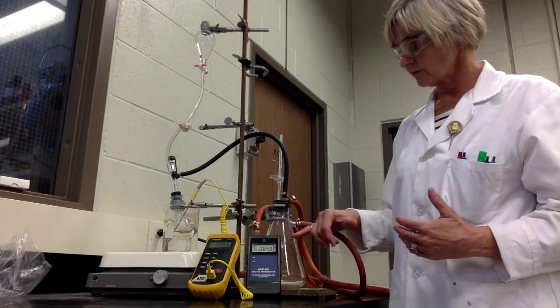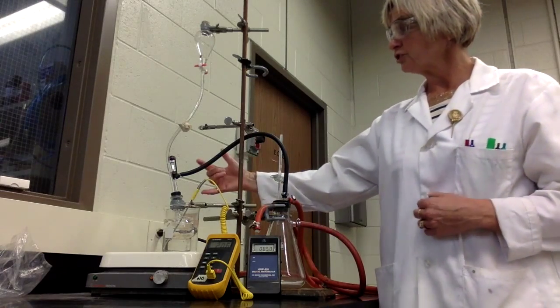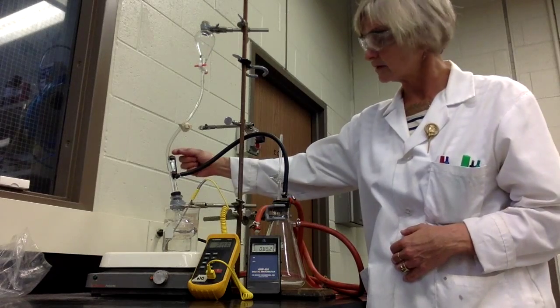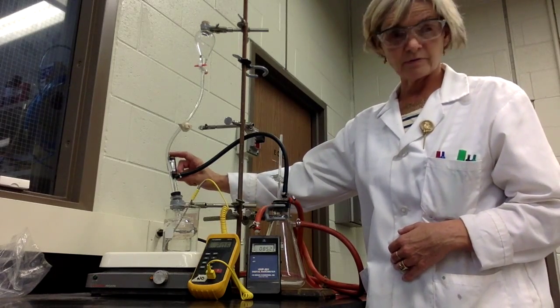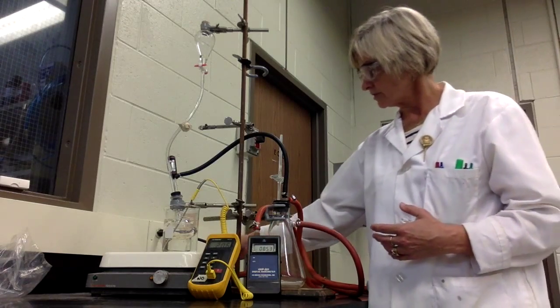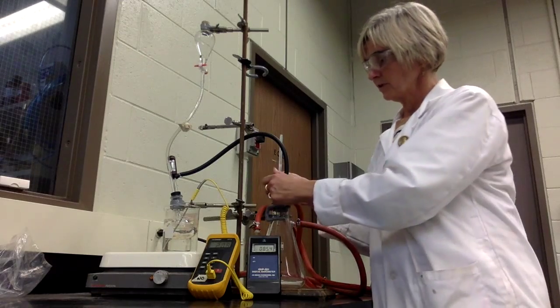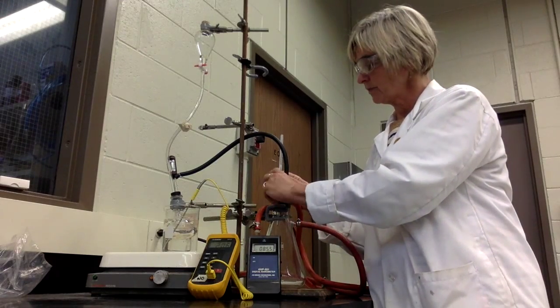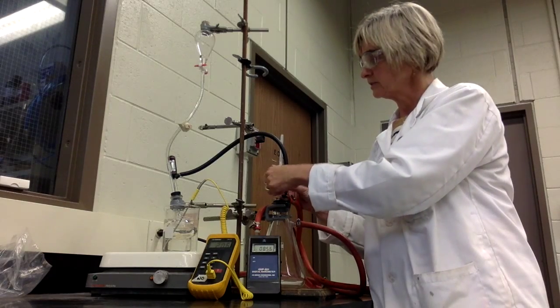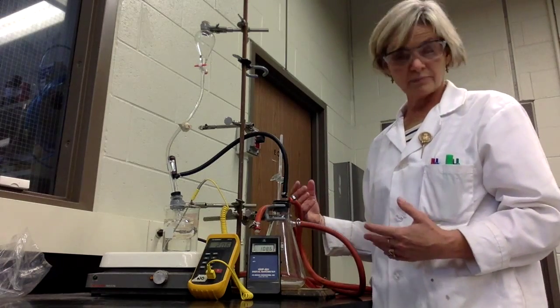What you'll see over time, as we increase the pressure, is an increase in your system temperature. That's the temperature on this thermometer here. To actually increase the pressure, you shouldn't have to manipulate this valve anymore. That can stay closed. What you will be doing is opening up the stopcock on the glass rod here, and that will let a little bit of air into the system just to adjust the pressure.